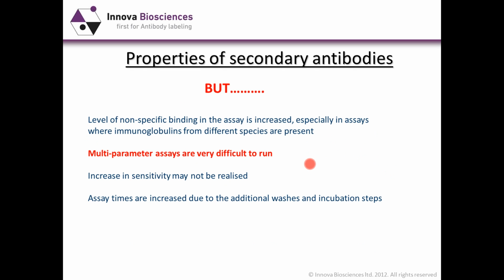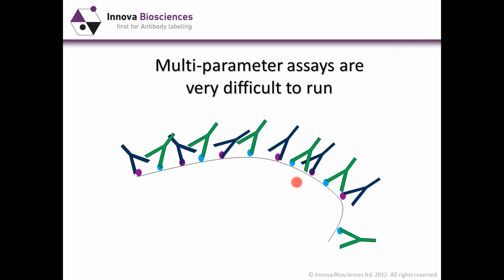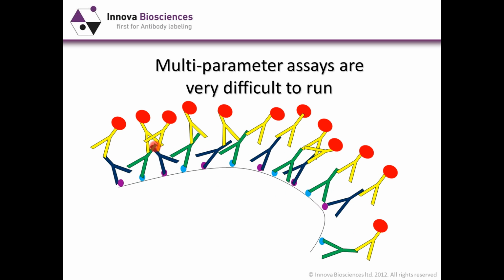In a similar way, multi-parameter assays can be very difficult to run if you're using secondary antibodies. And again, from a cartoon perspective, we can see how this will work. In this case, we have a cell which is expressing two antigens of interest, one of them in purple, another one in blue. The blue antibody is detecting the purple antigen, the green antibody the blue antigen, and you can see that this is a specific reaction. However, if you go in with a secondary antibody, you will see that in this case the secondary antibody binds both primary antibodies, and it's impossible to distinguish between those. Even if these antibodies are from different species, again, you may well see significant cross-reactivity.